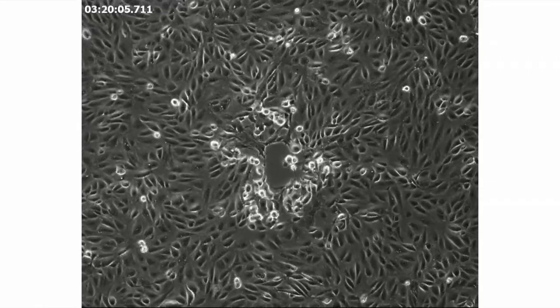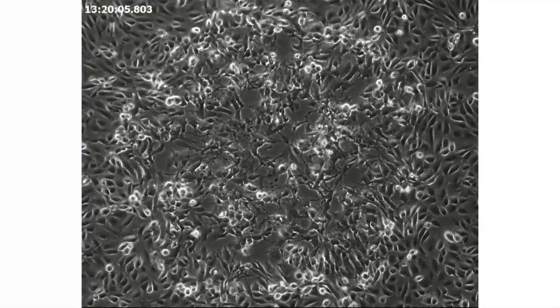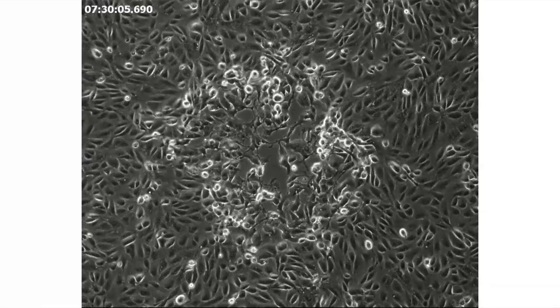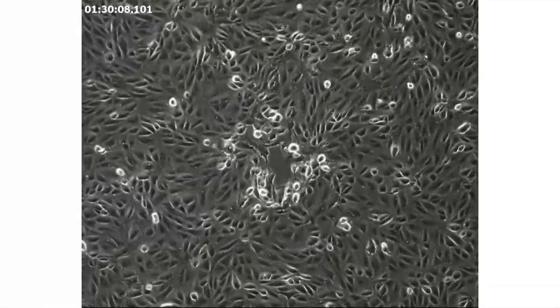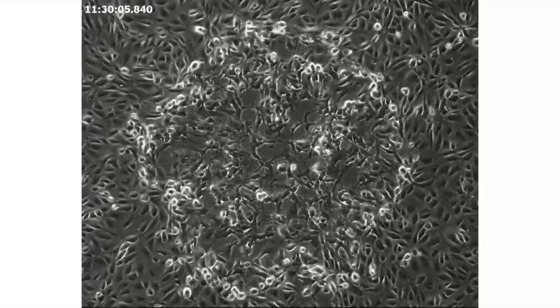Here's a time-lapse movie of a developing plaque. It was taken through a microscope, and as the cells become infected, they become shiny because the microscope light does not pass through them. You can see that over time the cells are killed by virus infection, and the resulting plaque becomes larger as successive waves of cells are infected. I think it looks like what happens when you drop a pebble into a pond.